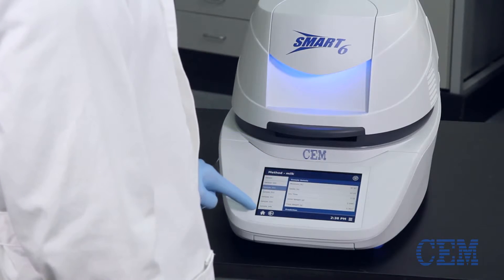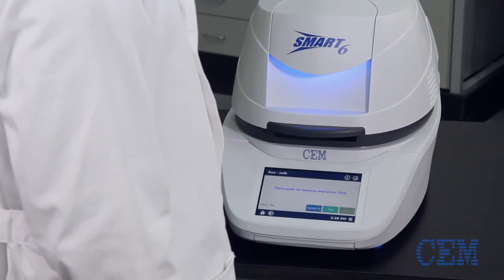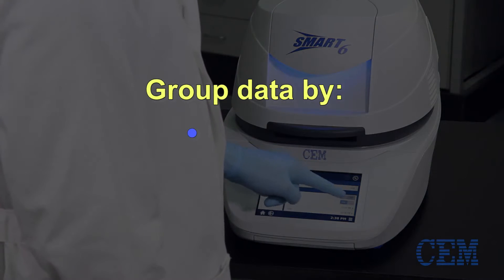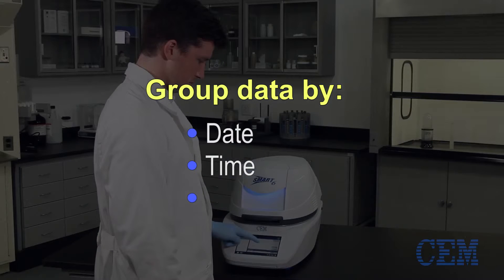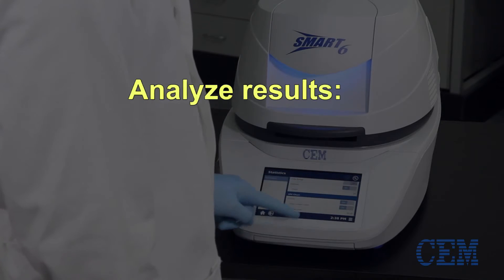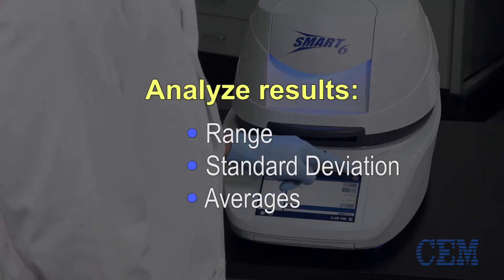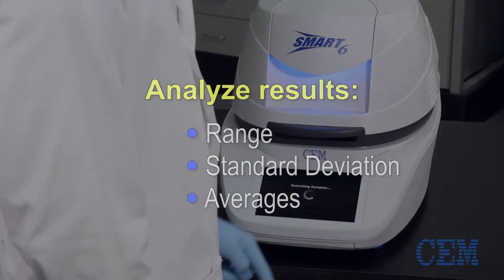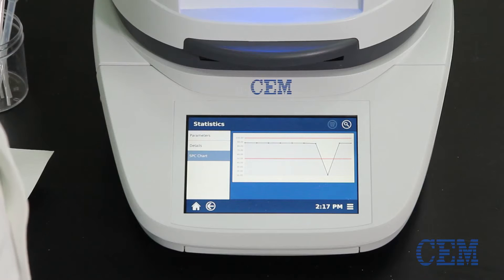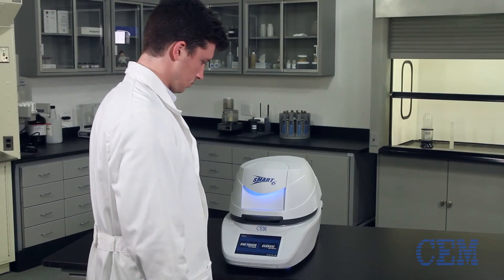If you wish to analyze a group of tests that have been performed under a given method, choose the graph button in the top right corner. Data can be grouped by date, time, or even the last 10, 20, or any other number of previous runs. Statistical results such as range, standard deviation and averages can be viewed, and graphs of the results can be displayed. High and low limits can be set on each graph to quickly determine if samples are out of spec.